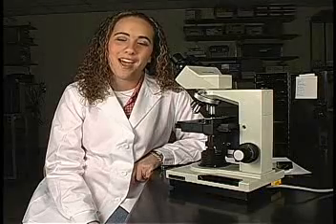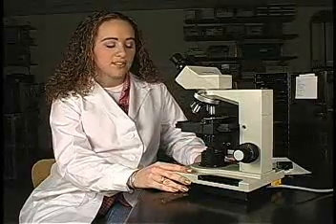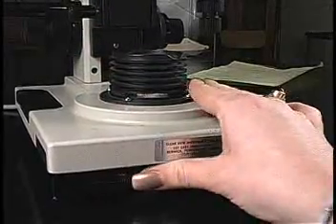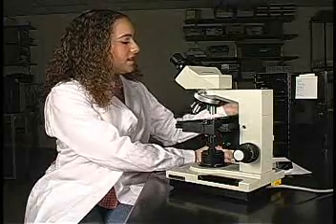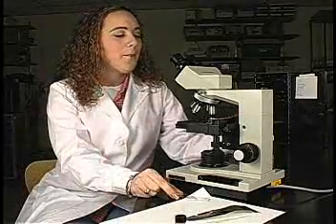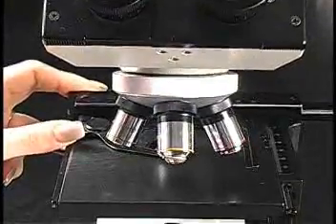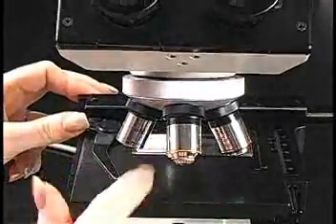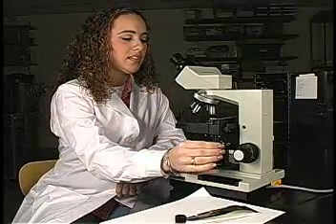Now we are ready to turn on the microscope and begin. Turn on your microscope and raise the rheostat all the way to 10. Now we are ready to put the slide on the stage. For this demonstration, we're going to be using the cross-section of a human artery. Make sure that your slide is not full of fingerprints. If it is, take a kimwipe and clean it off. Pull the stage clip open, place the slide on the stage so that it fits into the corner of the slide holder, and release the stage clip so that the slide is held securely. You can then move the slide using the XY controls.